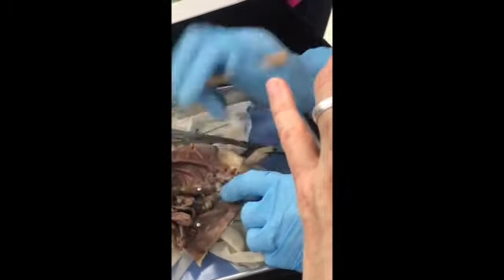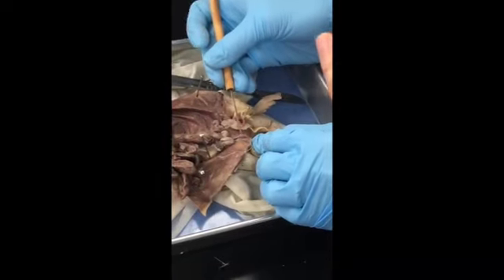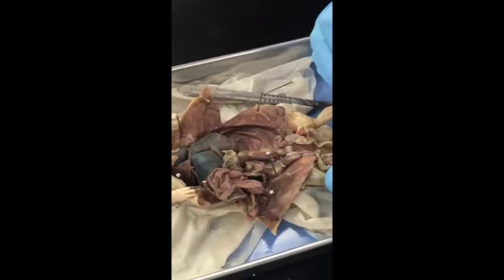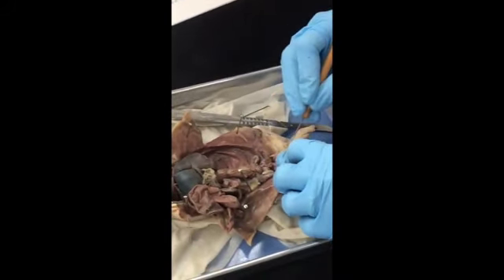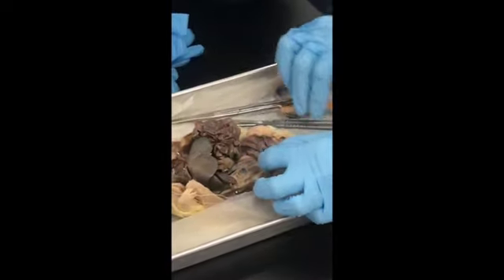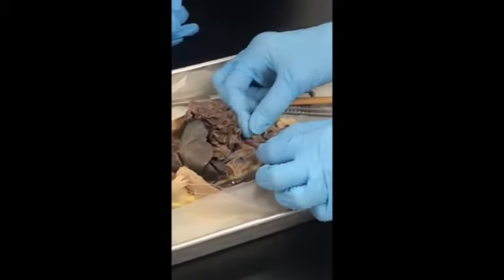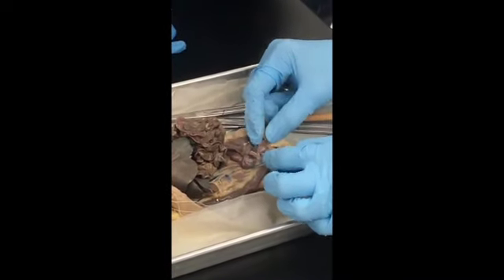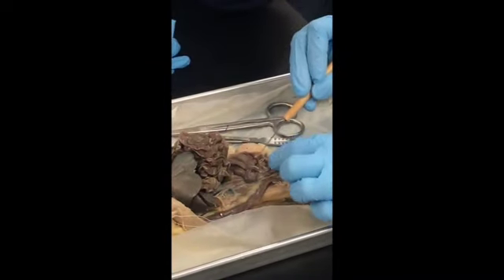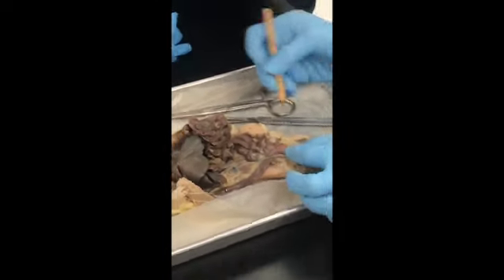Penis. And then from the seminal vesicles, run the vas deferens. So here's one. Okay. They always run down and they attach to the testes down here at the very bottom. Okay, so you'll have one on the other side too, which is probably ureter here. Runs down to the bladder. This is the bladder right here. Seminal vesicles are here. Okay. This is the prostate. This is the penis right here. Well, can't really see it too. There, right there. And then here are the vas deferens.